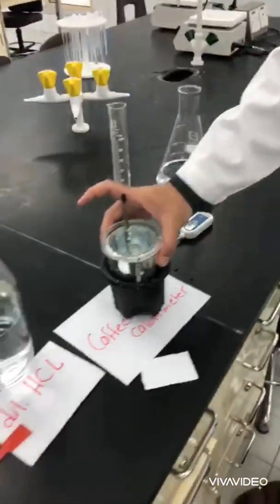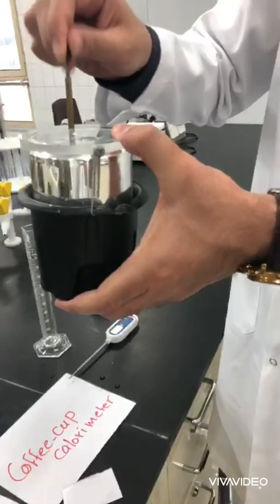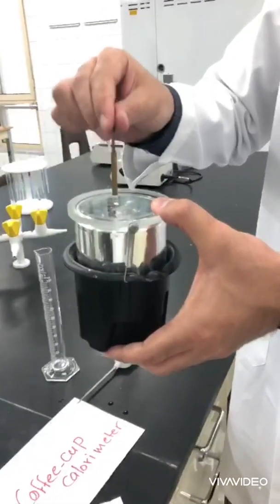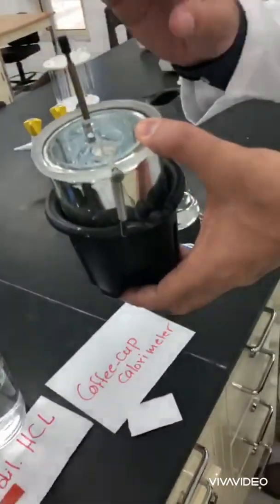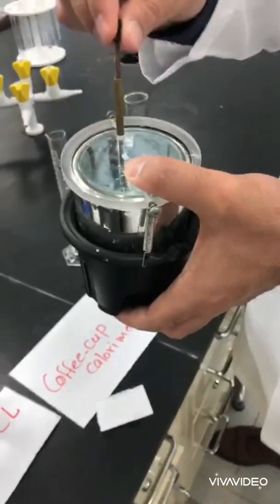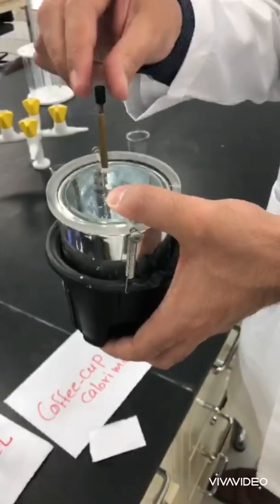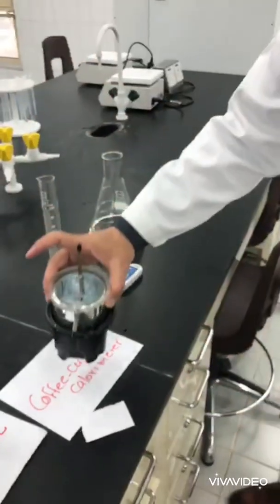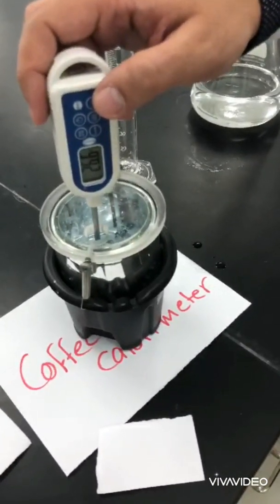Let's do a third attempt. By the way, this hole on the calorimeter should be closed to make the system completely isolated, but unfortunately we lost that piece, so I am trying to put my finger here just to close it. It will make no difference because this is a very short period of time, so I think the accuracy of the experiment will be acceptable. The last reading was 27.3 or 27.4 degrees Celsius.